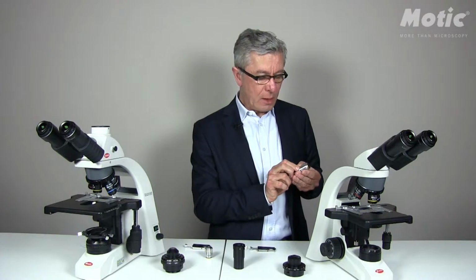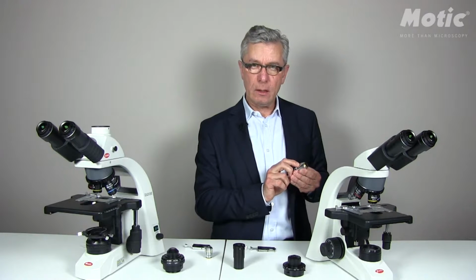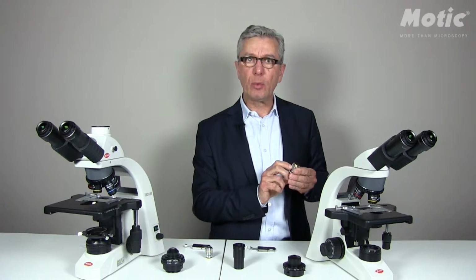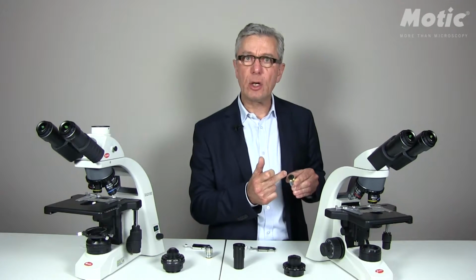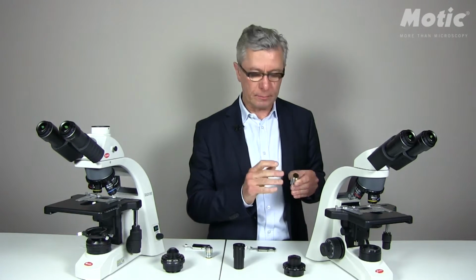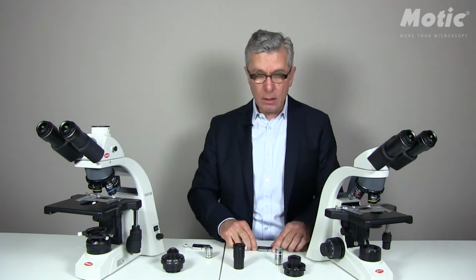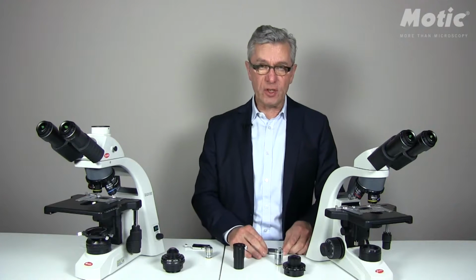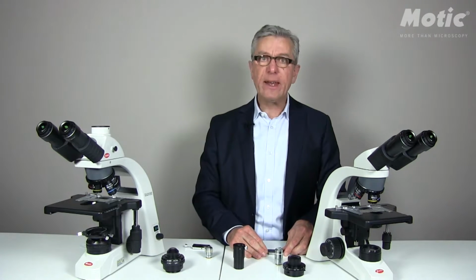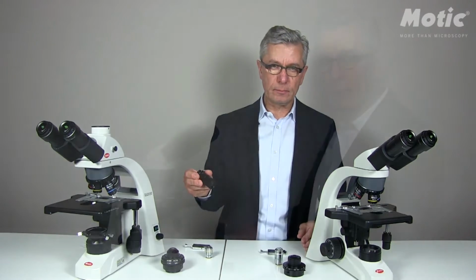Reading carefully, you will find an abbreviation called PH1, 2 or 3, which gives some indication about the ring size, a certain ring which is evaporated inside the objective on one certain lens. This ring size should be in correspondence with the ring of the illumination. Both sizes have to fit together. The final adjustment has to be done with a centering telescope.